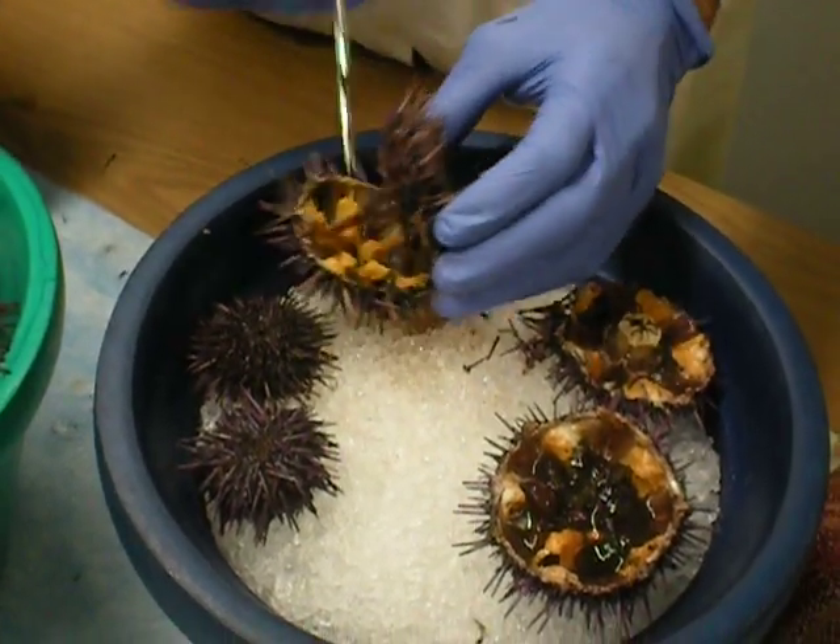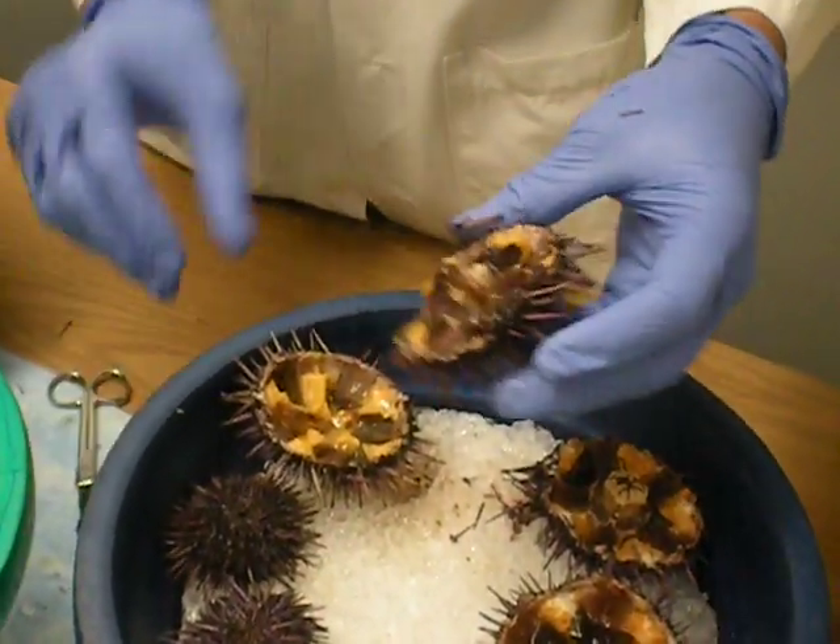People apparently do this. Go into YouTube. Really? Google. Alright, this is the female.